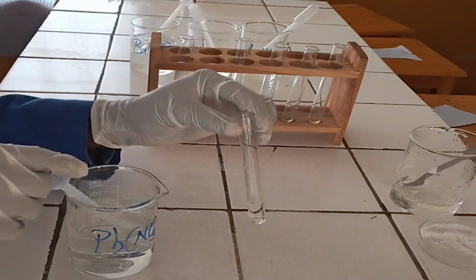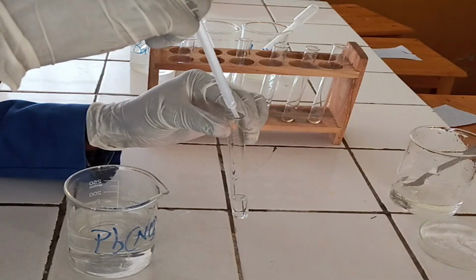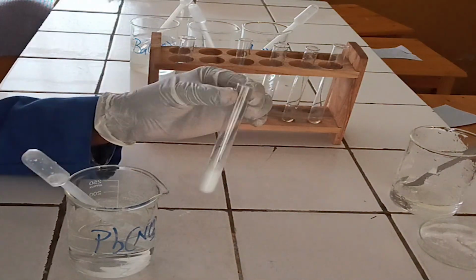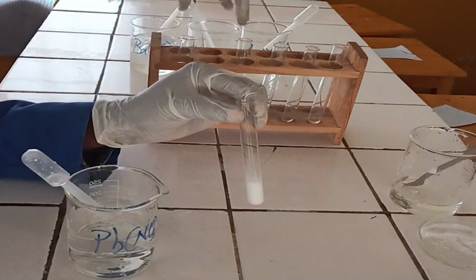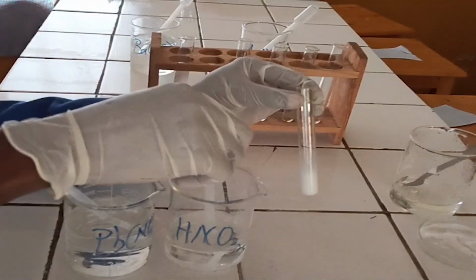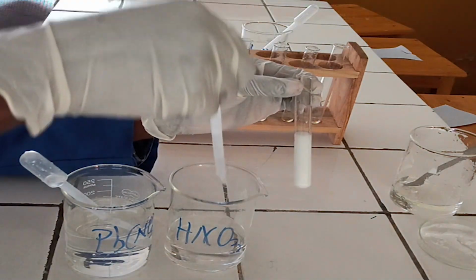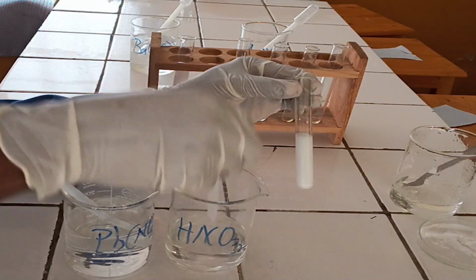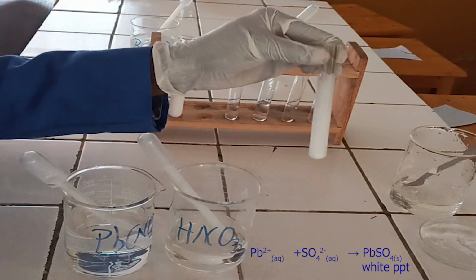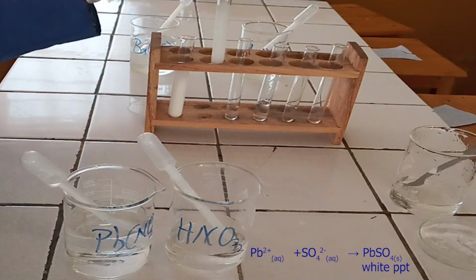To the second test tube, add a few drops of lead nitrate solution followed by diluted nitric acid. As you see, lead nitrate reacts with sulphate ion to form white precipitate. The precipitate formed is insoluble in diluted nitric acid. Below, there is the ionic equation for this reaction.